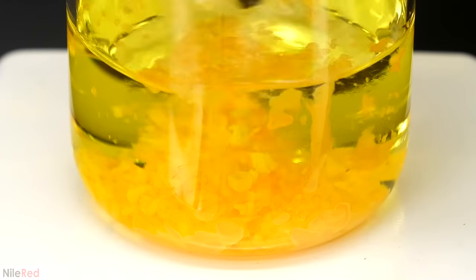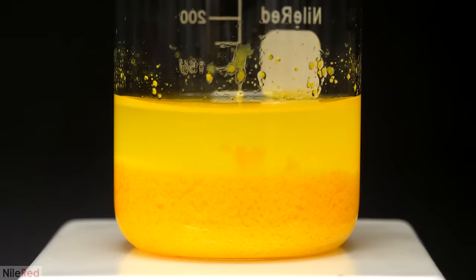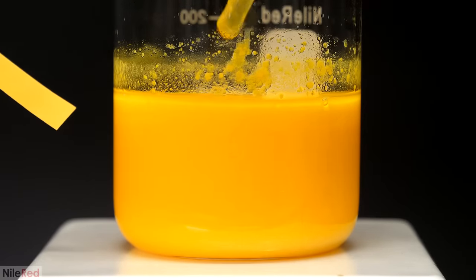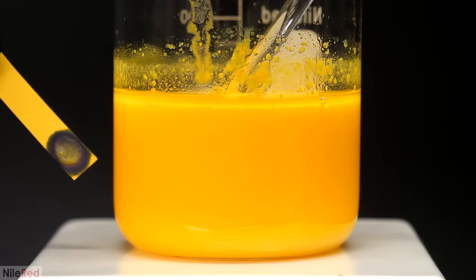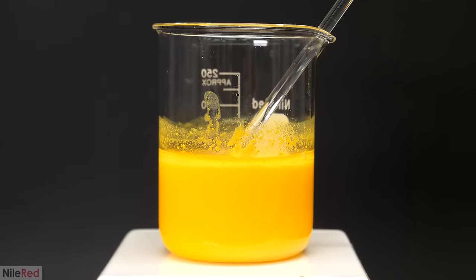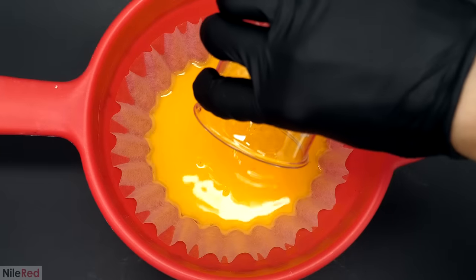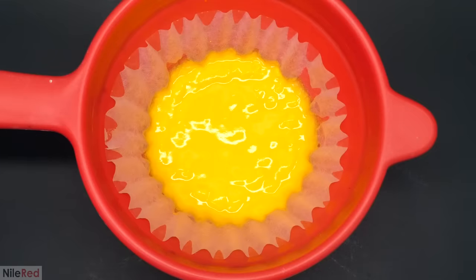After this I let it sit for a bit to make sure it all fully reacted, then filtered it off through a simple coffee filter. When most of the water had passed through, I washed it a few times with distilled water, let all that water pass through as well, and now I had some relatively clean sodium diuranate. It was all still wet and goopy and I'd have to dry it out, but setting up a fan would shoot small amounts of dust into the air, and I didn't feel comfortable doing that with uranium.